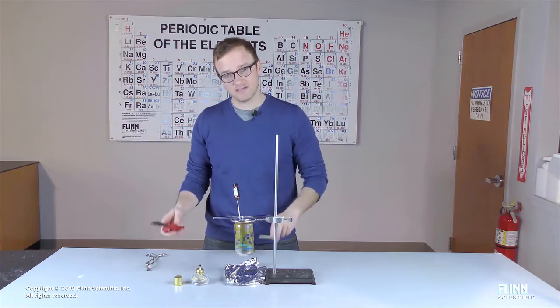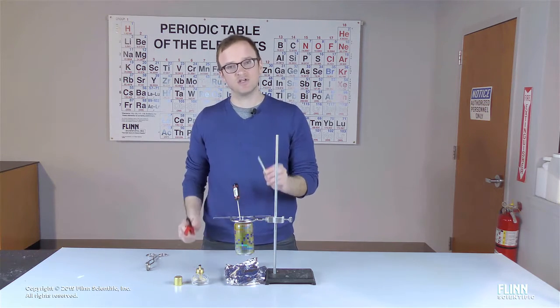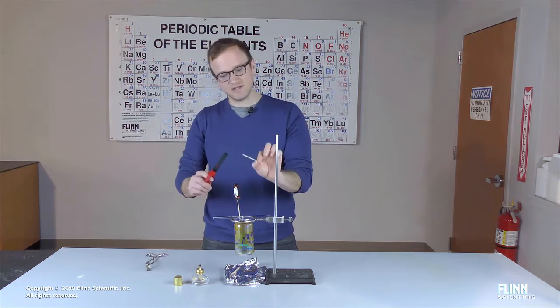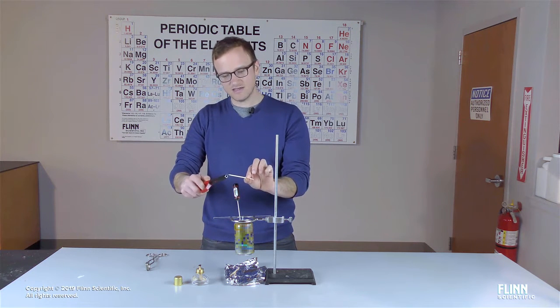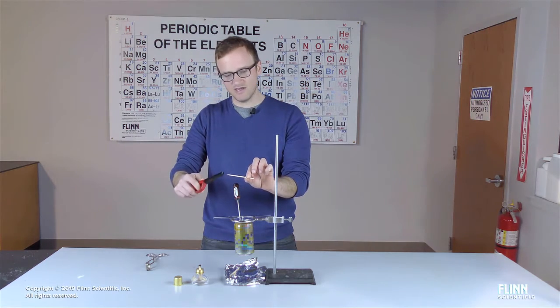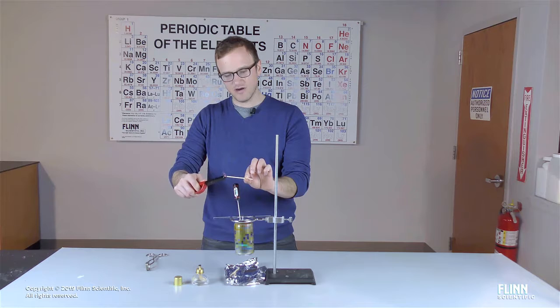I'm going to show you a scaled-down analogy of a combustion reaction of a tree by burning this wood splint. If I ignite this, what you'll notice is the burning or combustion of the splint. You can see the little ember there at the end.